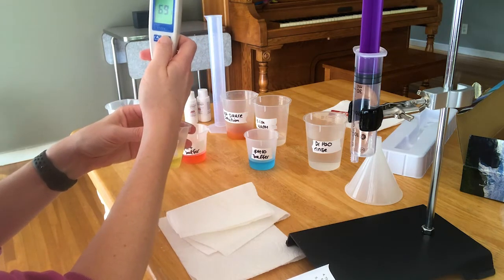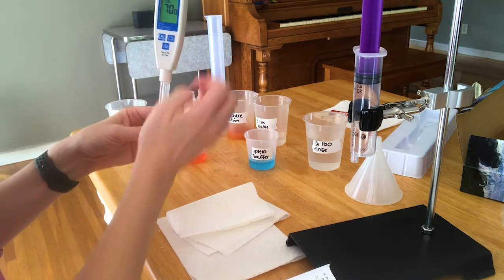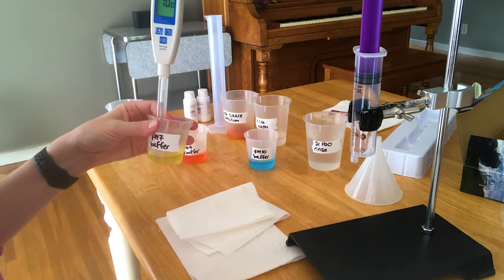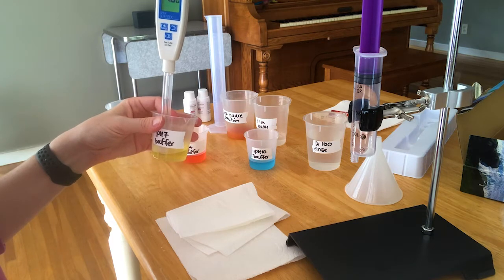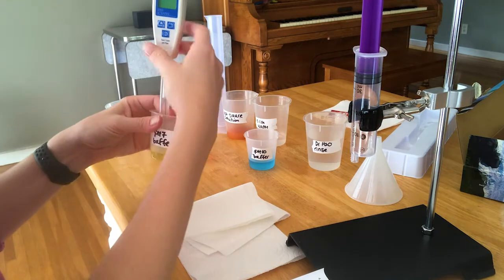Press the calibrate button. It'll say 7. Then I just have to be patient this time. So sorry it's cut off, but what it says is SA, and then it says end. Then I'm okay to take it out.